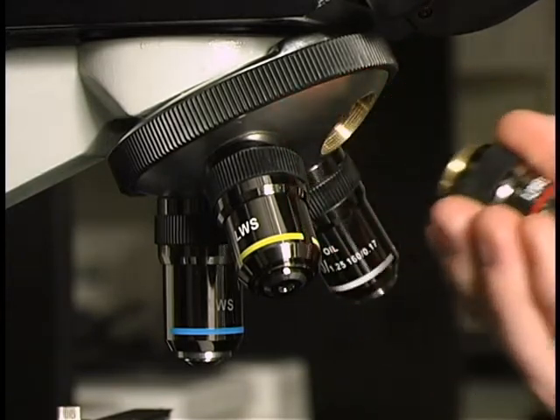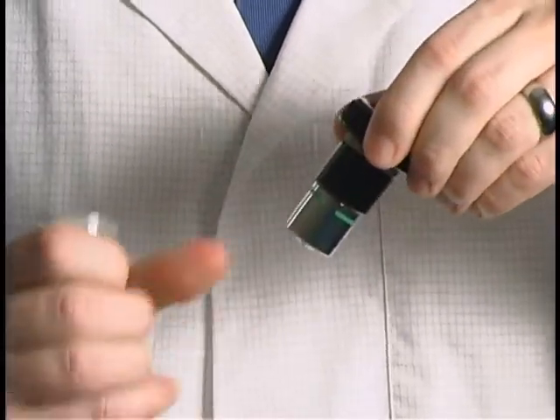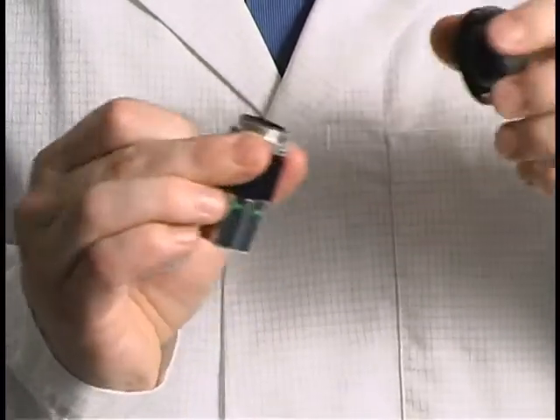If a space is not available, remove one objective. Remove the Paralens Advance body and its attached objective lens from the protective vial.